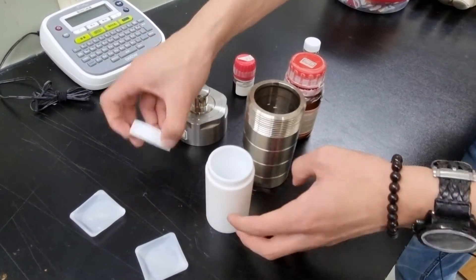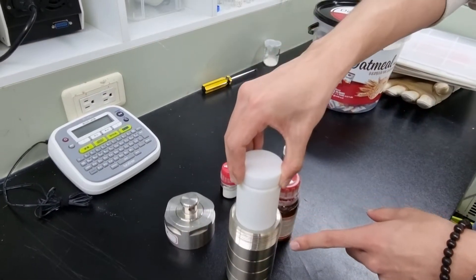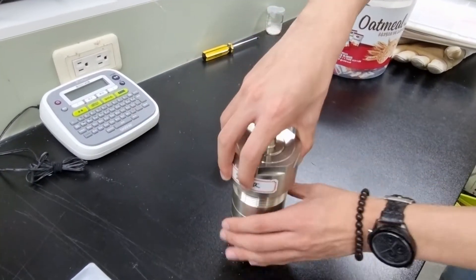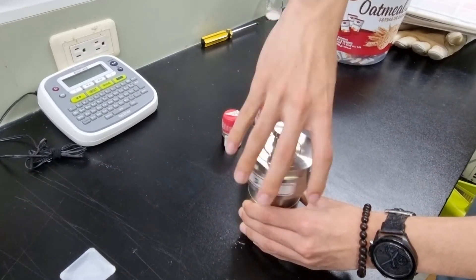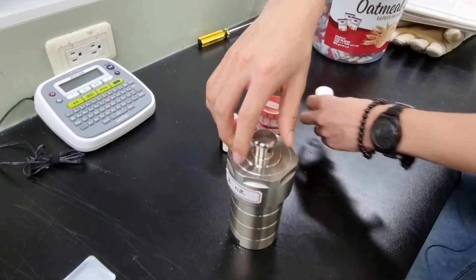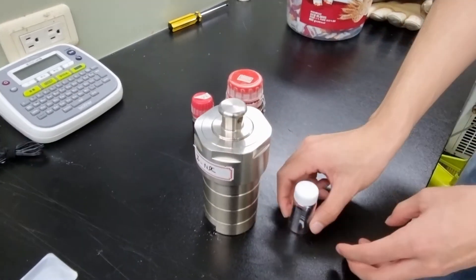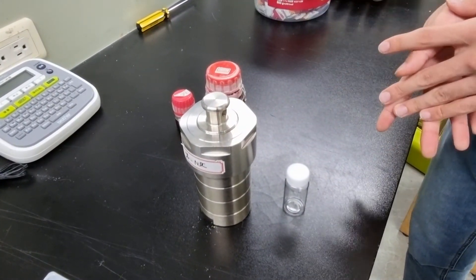Once you're done with sonication, you cap the top and put it inside like this, then screw the lid, closing it. This will be equivalent to the vial — it can be considered the same system, but we use this in high-temperature requiring procedures.